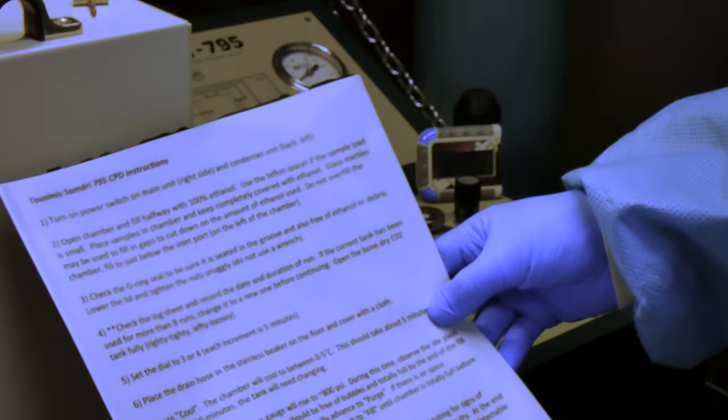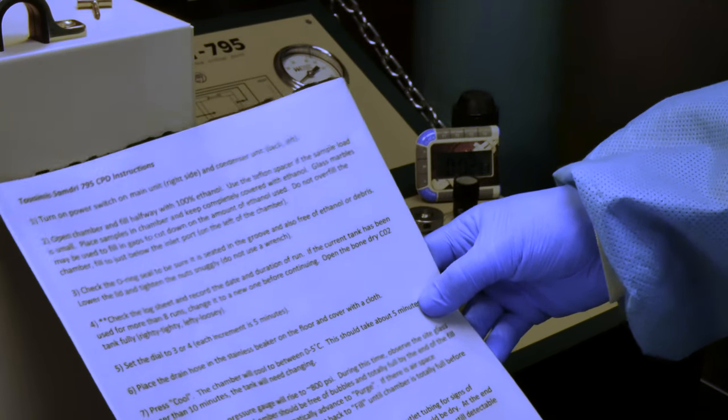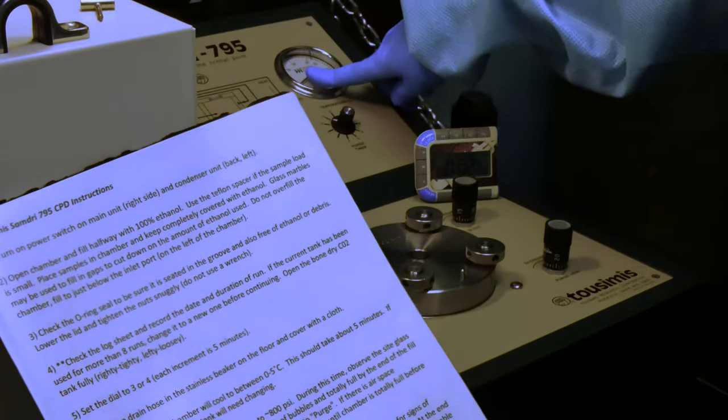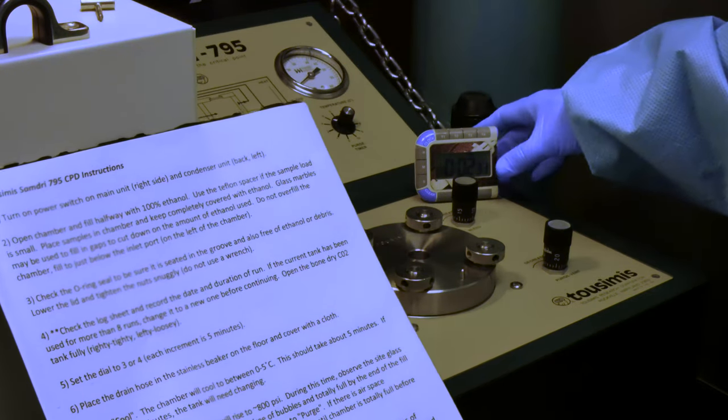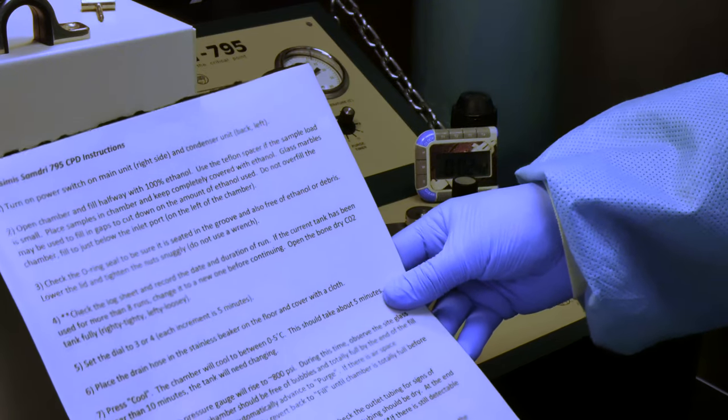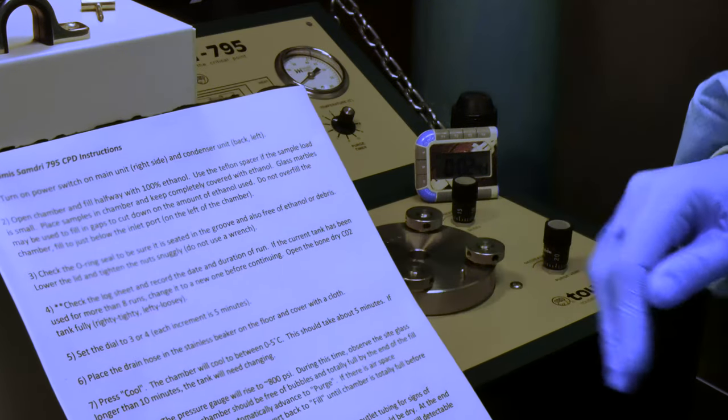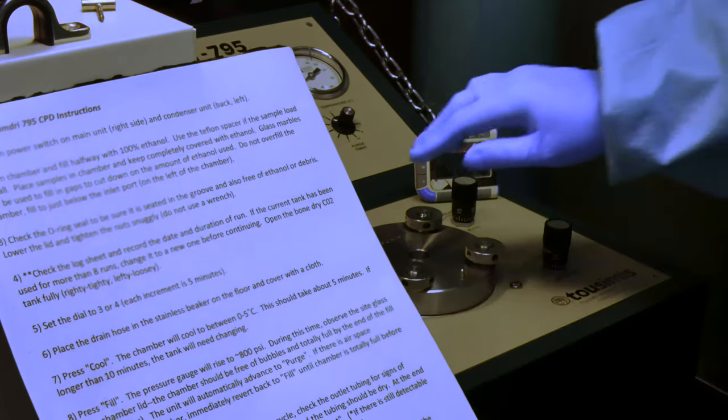We have pressed cool. There is a noise that is associated with this step. And you can see that it's dropped our temperature to below zero, and it's taken about two and a half minutes, just shy of that. If it takes longer than ten minutes to do this, it is an indicator that the tank needs to be changed. Our next step is to press fill.